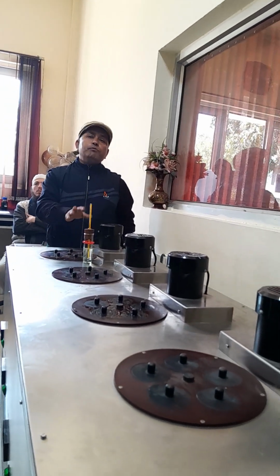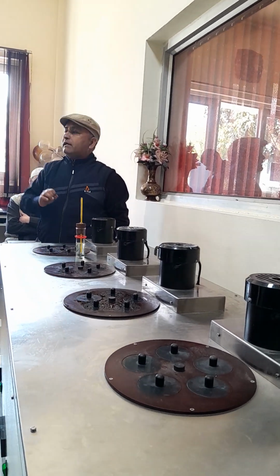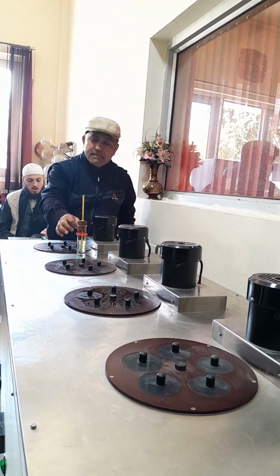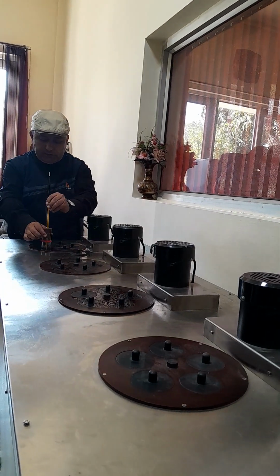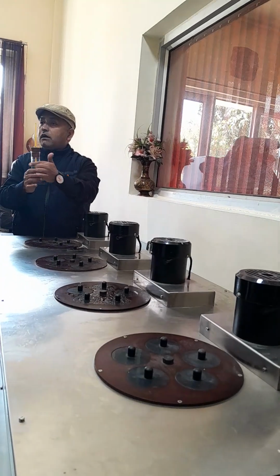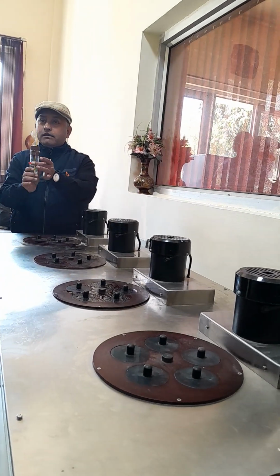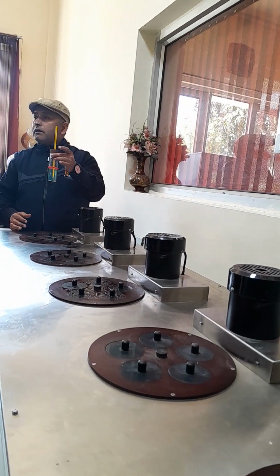But when you are reporting the cloud point, you report with a difference of 1 degree. So when you see the cloud point, you keep this tube inside, and you also use this rubber cork. Why? Is it a mechanical stopper?